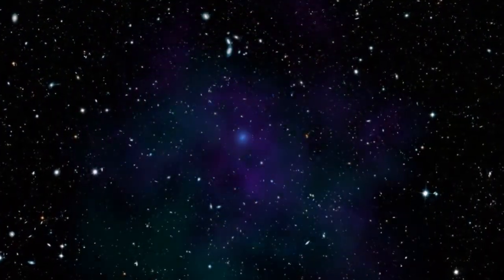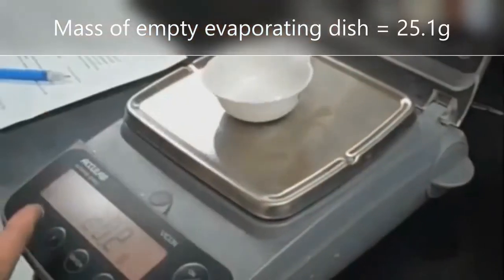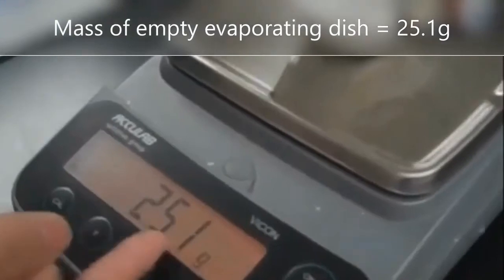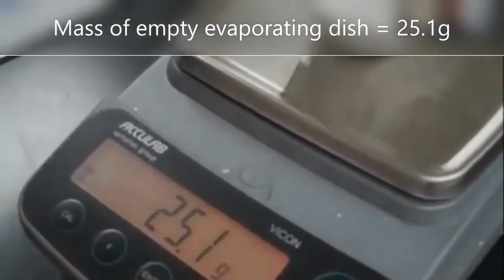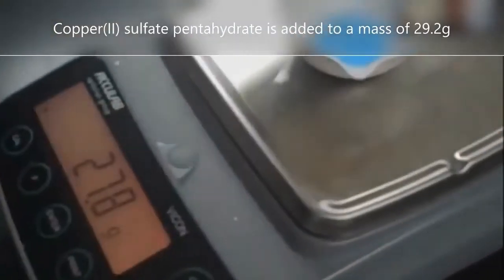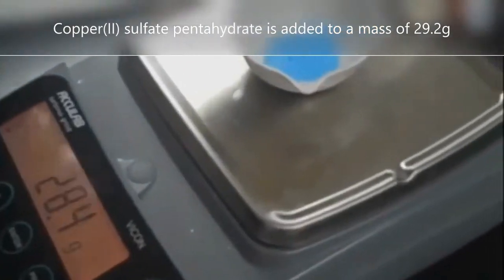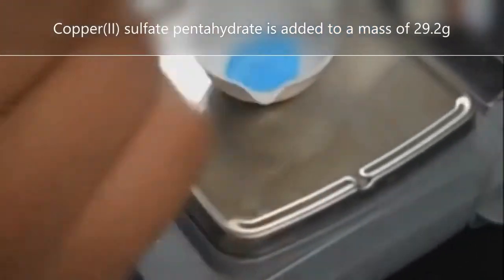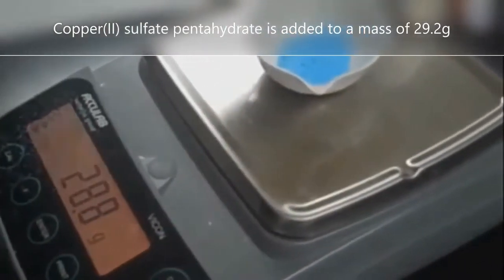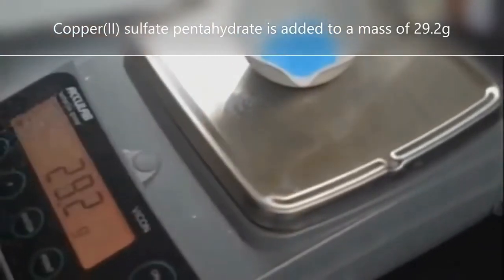The first step in the experiment was finding the mass of an empty evaporating dish, which measured 25.1 grams. Approximately 4 grams of hydrated copper sulfate, a blue crystalline powder, was added to the evaporating dish until the mass measured 29.2 grams.